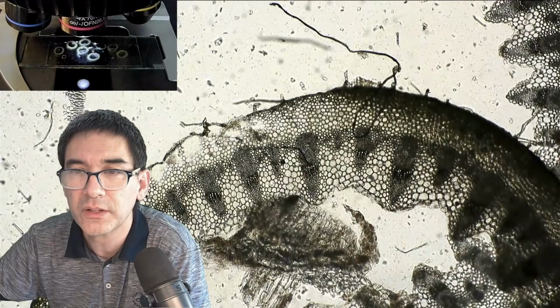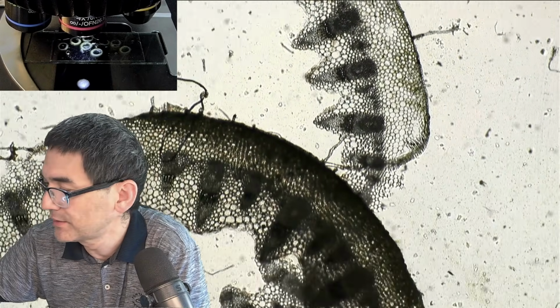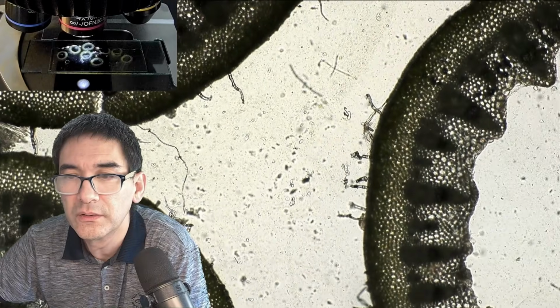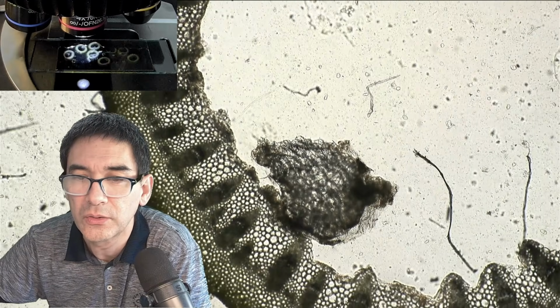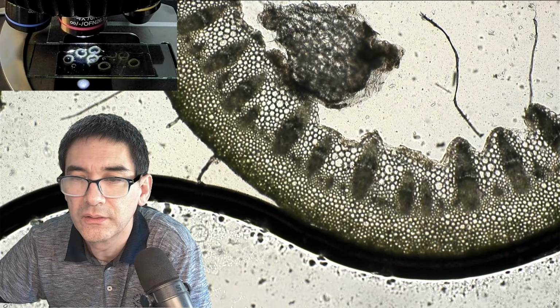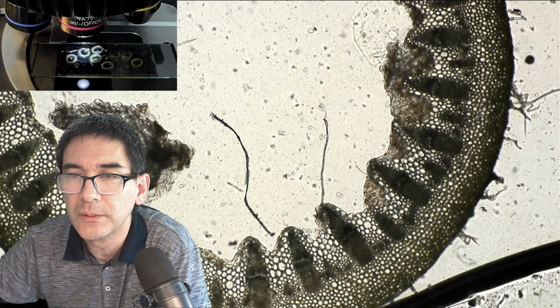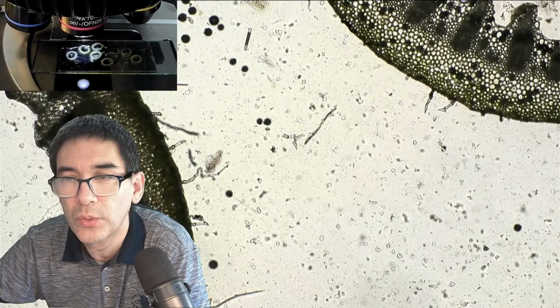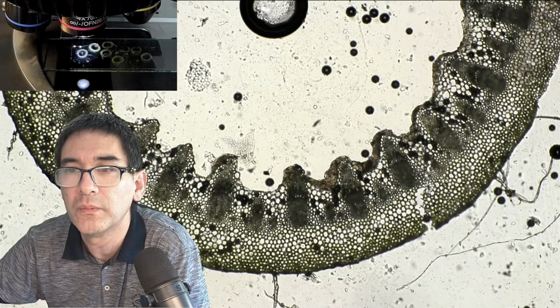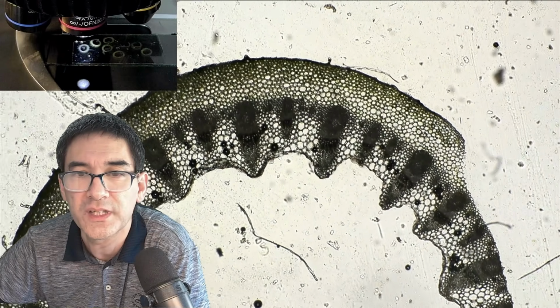Okay. This one is a little bit ripped apart here, but those here are quite nice. And this one here is a little bit thicker. You see that it's a little bit darker already. Here that's the air bubble at the bottom. But it actually shows that this technique works quite well, even though it was actually a fairly soft specimen.